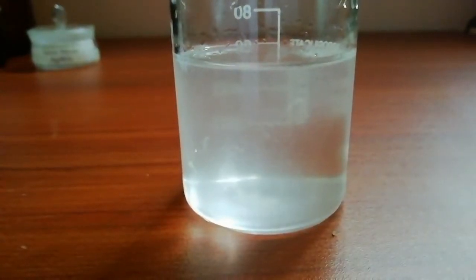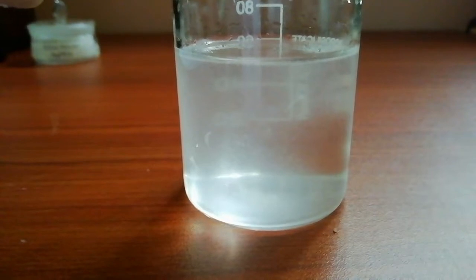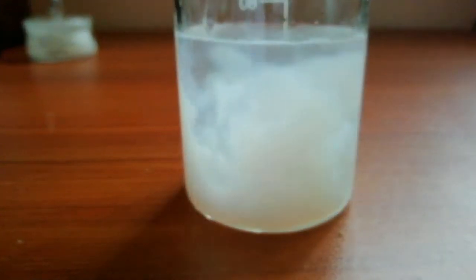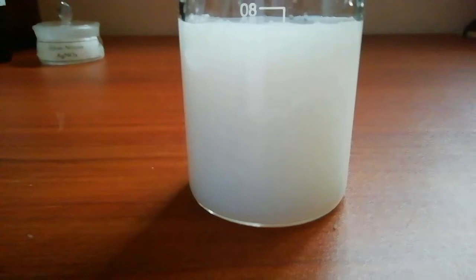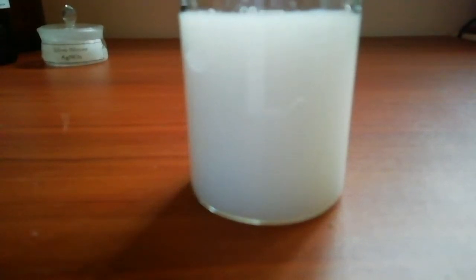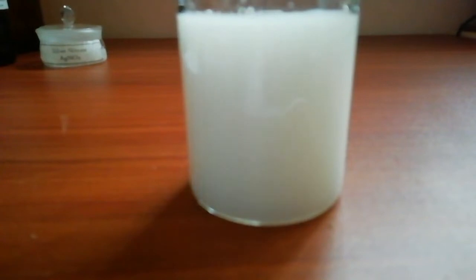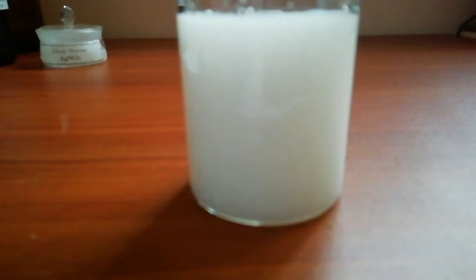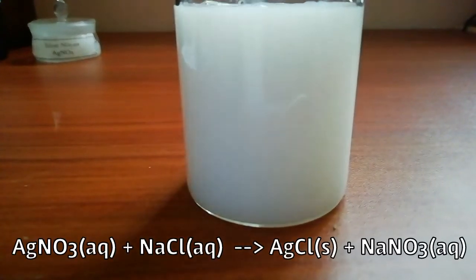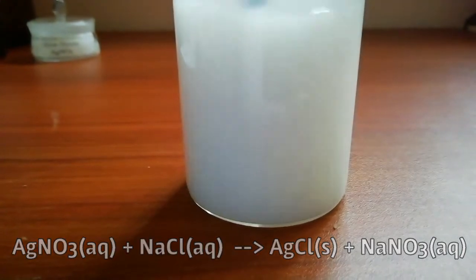Now I add some silver nitrate solution to the sodium chloride solution. The sodium chloride reacts with silver nitrate and it forms silver chloride.